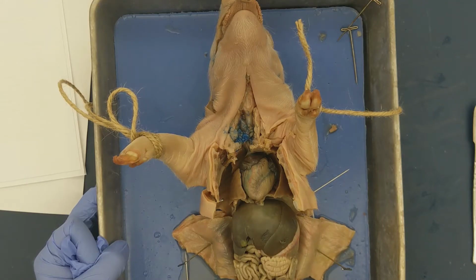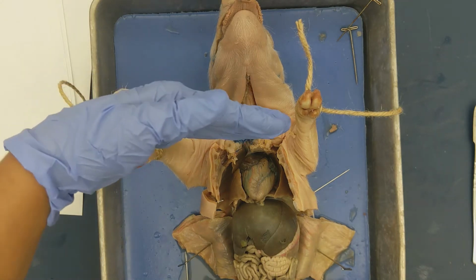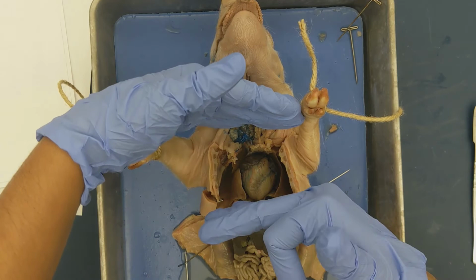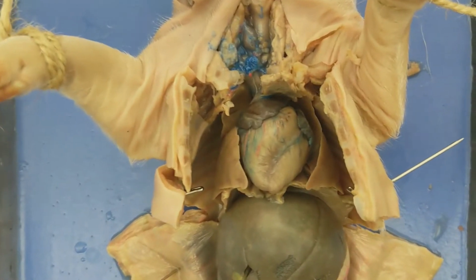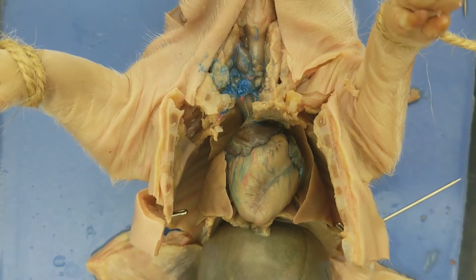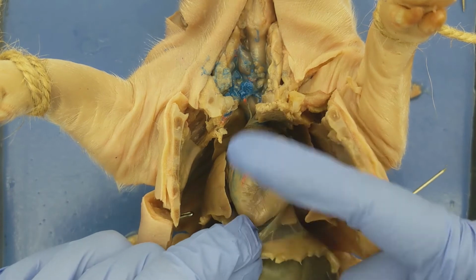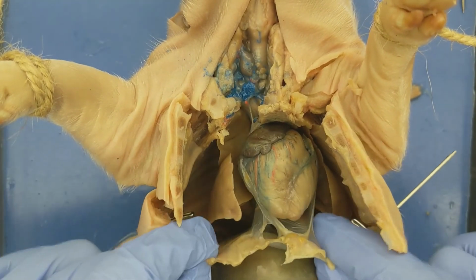Now let's take a look at some of the structures associated with the thorax, or the thoracic cavity of the pig. Remember, the thorax is the region from the shoulders until an internal structure in the pig. And let's zoom in and I'll show you where that internal structure is. So we're kind of zooming in on the thorax right now, the thoracic cavity. The internal structure that separates the thorax from the abdomen, which is posterior to it, is this muscle, right?